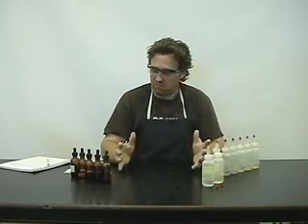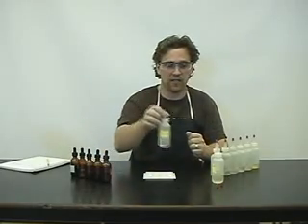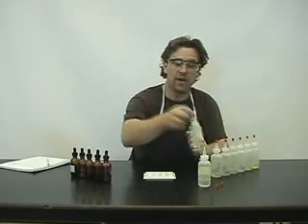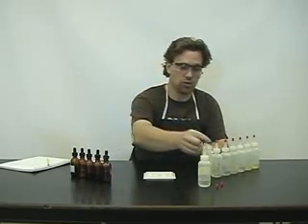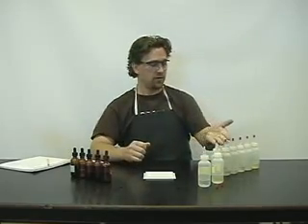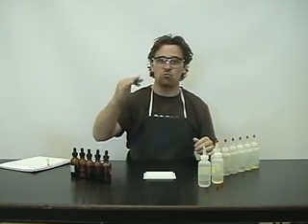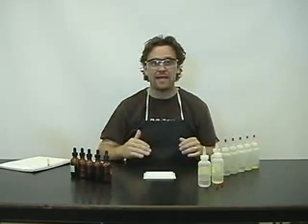The lab itself is very easy. We use spot plates, we have some acids — we have a strong acid, HCl, and a strong base, NaOH. We have five indicators and six acids. The whole point of this lab is to be able to organize all of these from strongest acid to weakest acid.